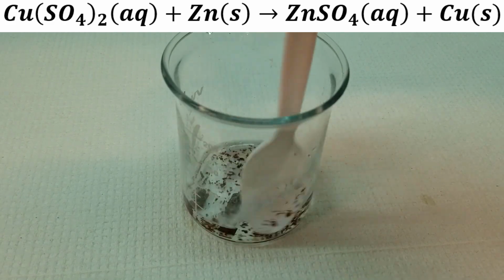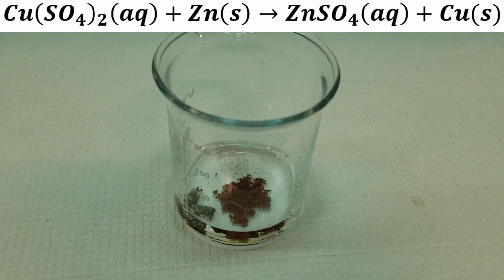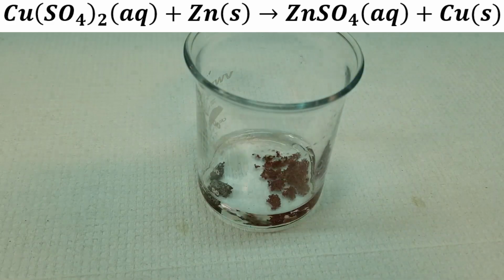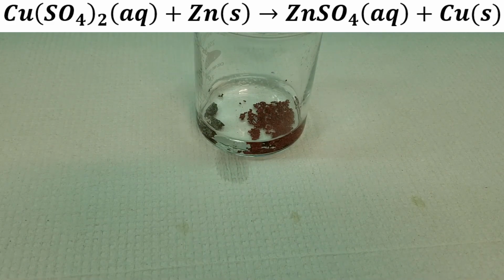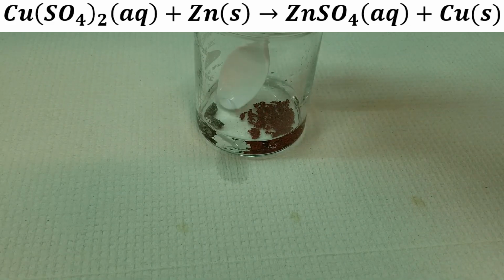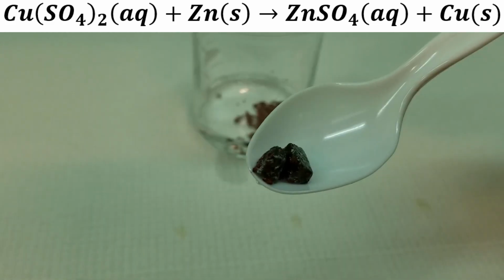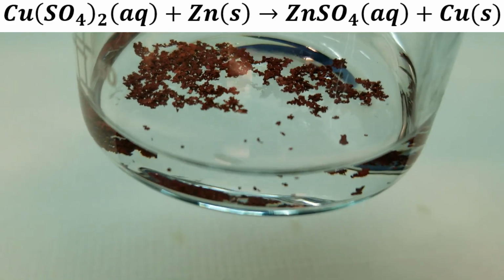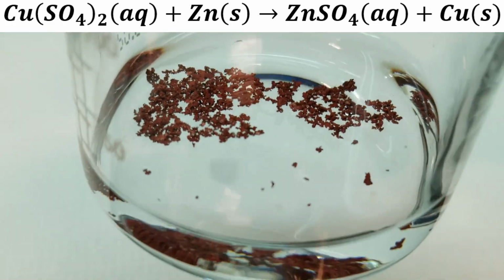Okay, and I've been stirring this mixture, waiting for that blue color to fade, and at this point I'm not seeing any more of the blue color, so I think we've recovered all of our copper. You can see that our copper metal is this brown red powder, and the zinc that we added, that'd be our 2 big chunks of zinc metal. So there's our copper metal. It comes out as a reddish brown powder.